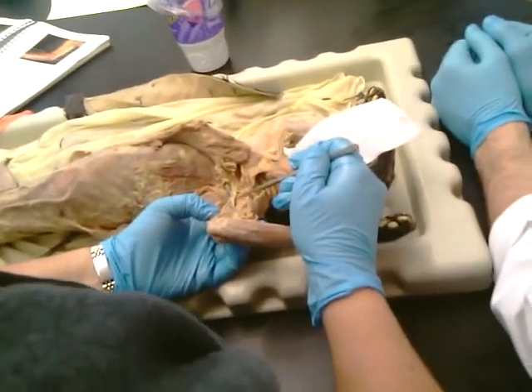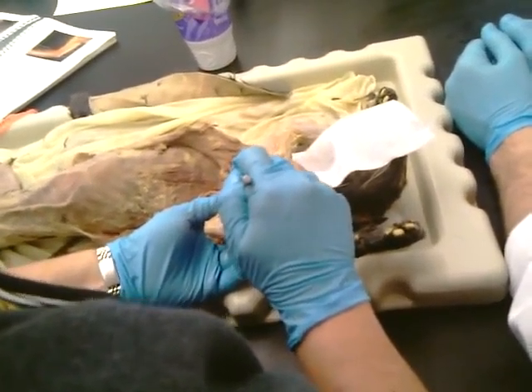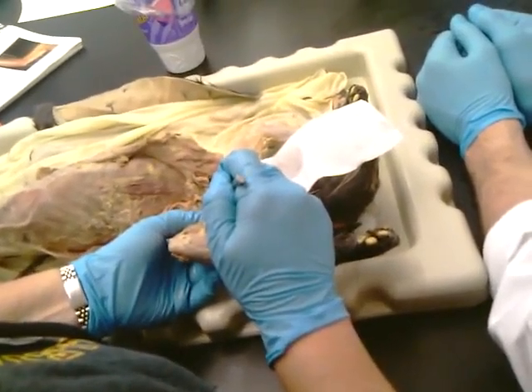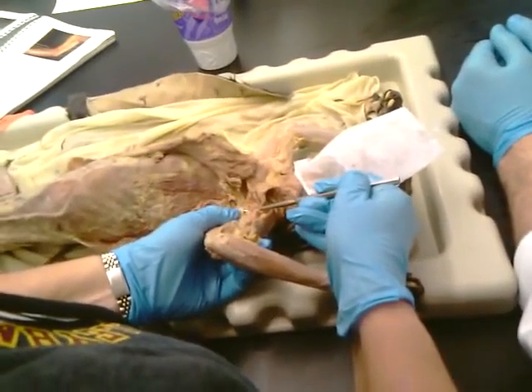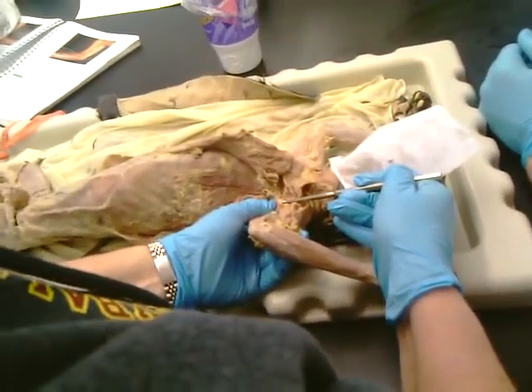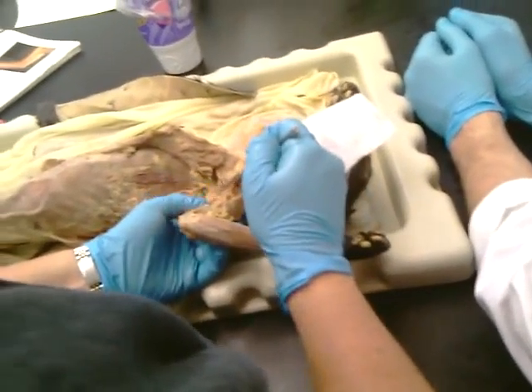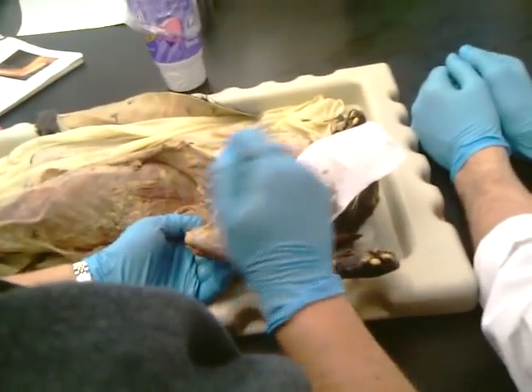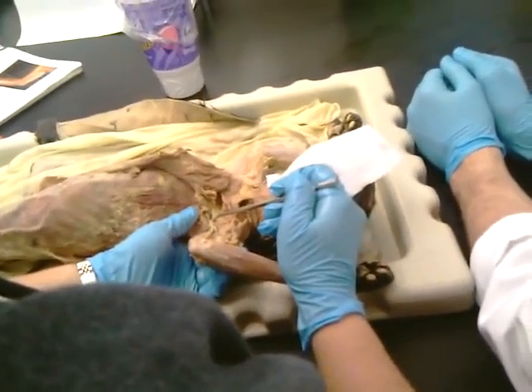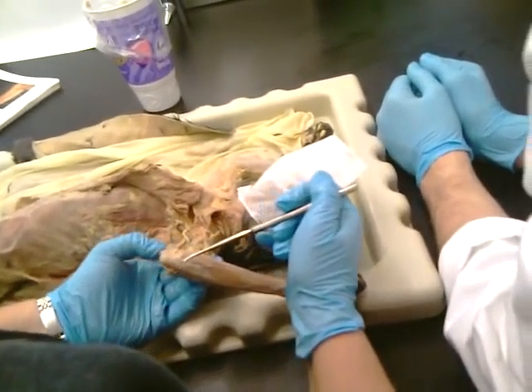The one going in the middle? Median. And then the radial nerve is hiding up here, kind of underneath stuff. It's right there. Radial nerve is big. It's flat, wide, and short. Okay, so it's going to come diving down here, and it goes into the triceps. Okay, so then here we have arteries and veins, which we will name later.